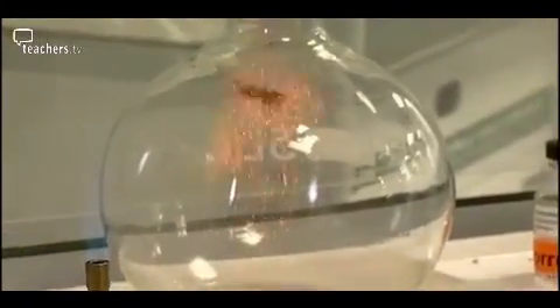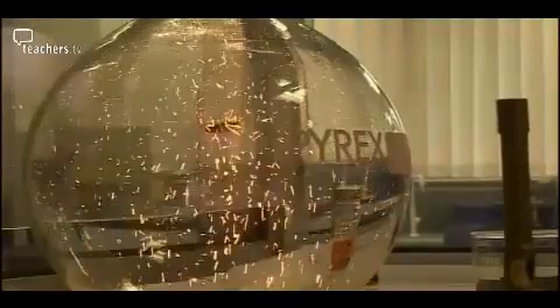You need to move quite quickly. So here we go — bung off, into the flask. The flakes glow as chromic oxide catalyzes the reaction of ammonia and oxygen from the air.